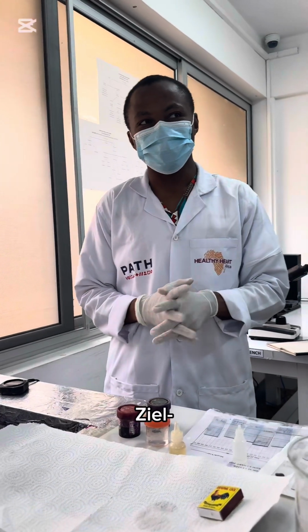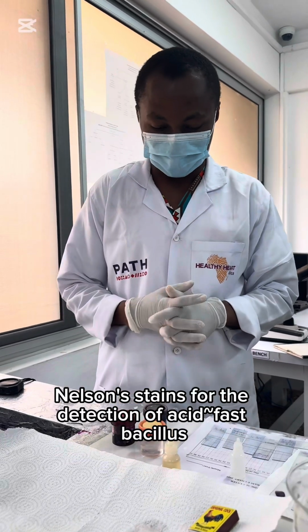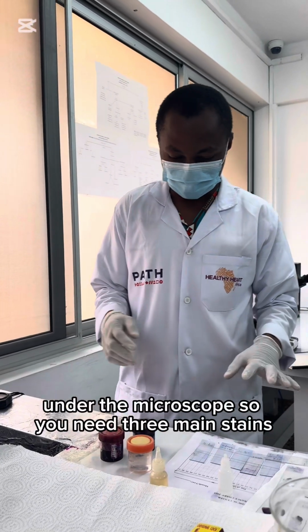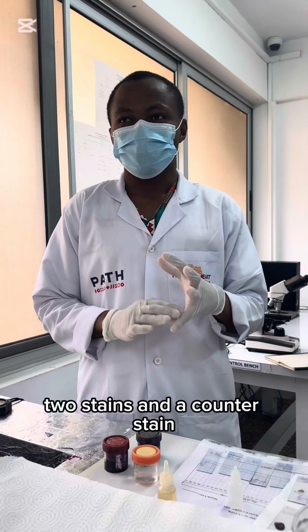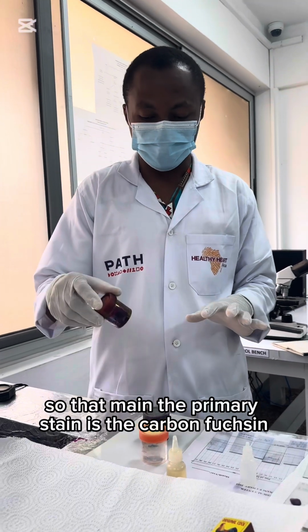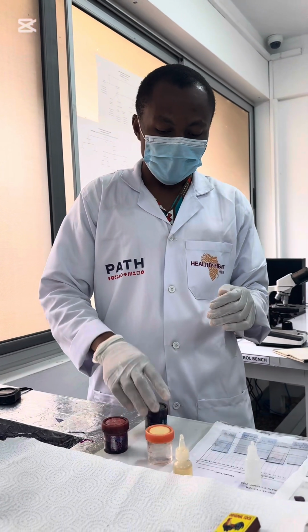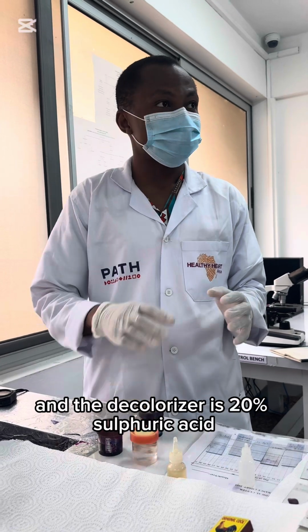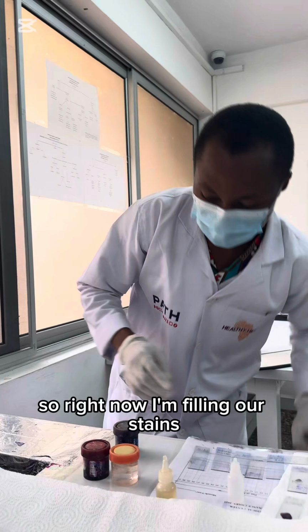Ziehl-Neelsen staining for the detection of acid-fast bacilli under the microscope. So you need 3 main stains, 2 stains and a counter stain. The primary stain is the carbol fuchsin, then the counter stain is methylene blue, and the decolorizer is 20% sulfuric acid. So right now I'm filling the stains.